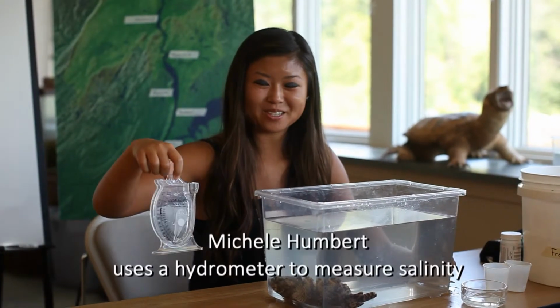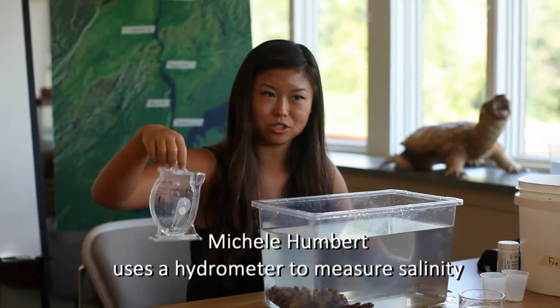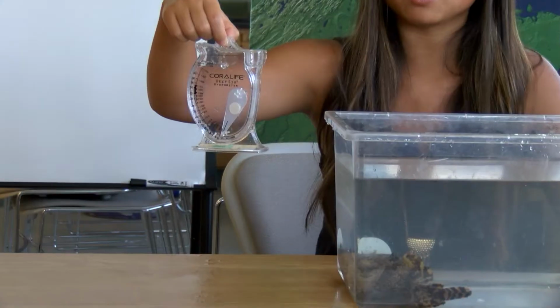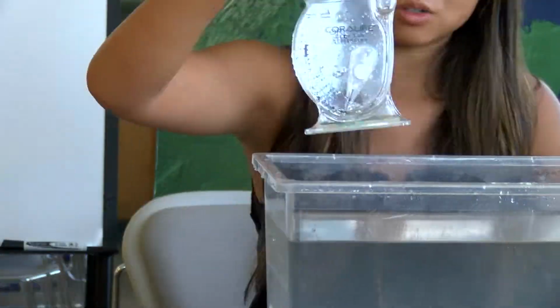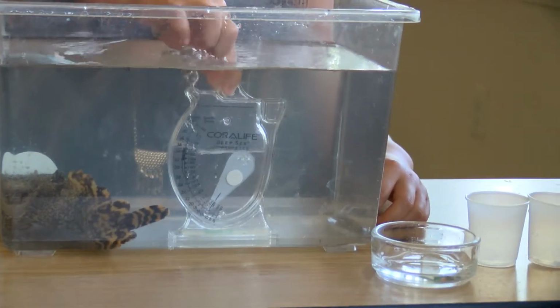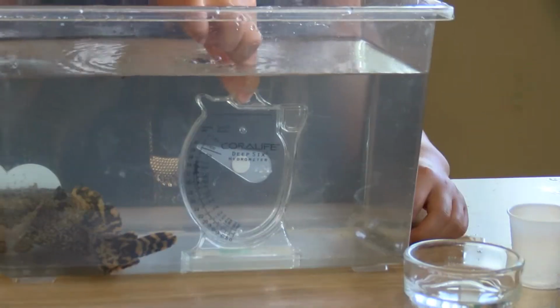So today we're going to start off measuring salinity by using a hydrometer, this little plastic instrument, which can be found at any local pet store. It's pretty cheap. So first we're going to dip it into this water and figure out how much salt is in it. And you want to wait for all the bubbles to stop, and then gently take it out and tap it.